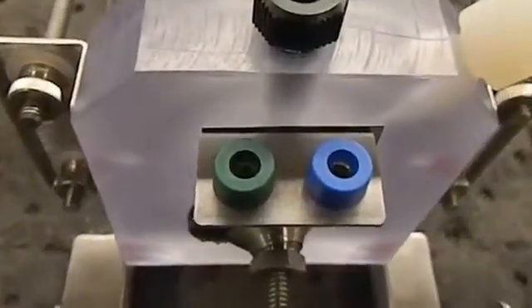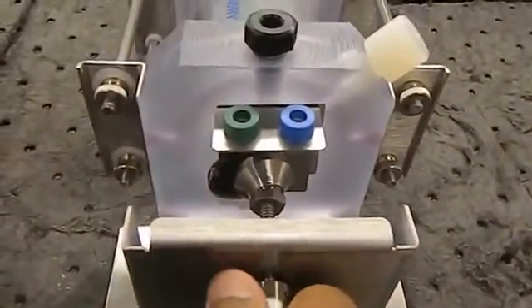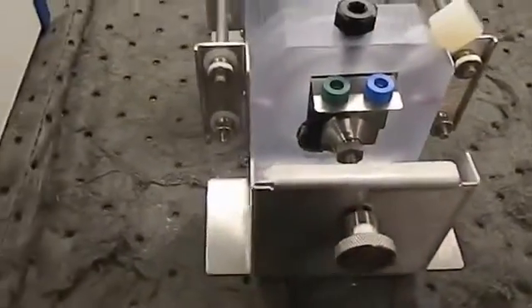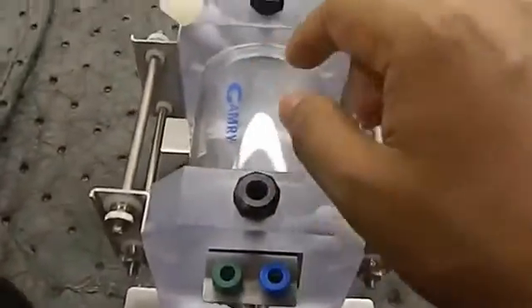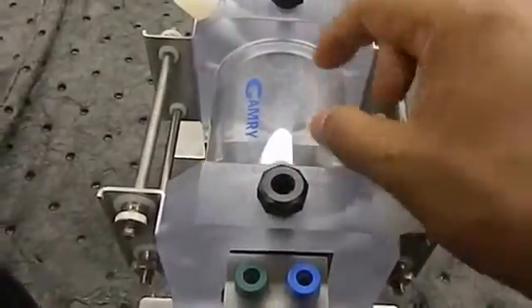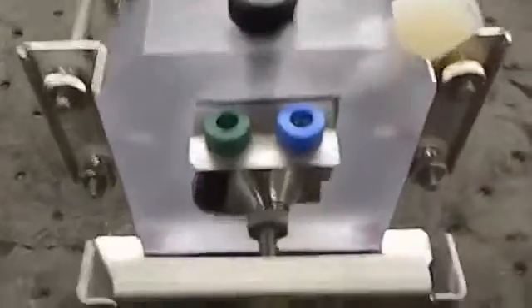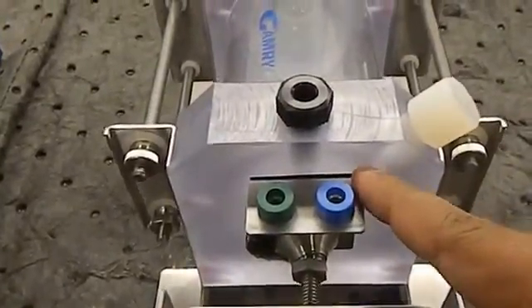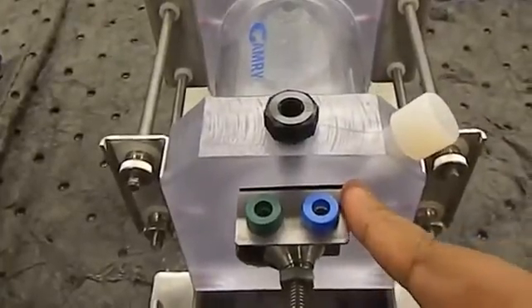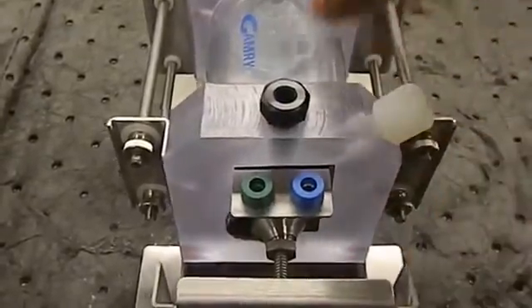So we see the metal has been set here and you can screw it a little bit more. The metal piece is set now in this cell. You have to pour in the corrosion liquid you have to work with — it depends on your application — because the Tafel parameters and the pattern of the Nyquist curve will change as per the corrosion liquid.